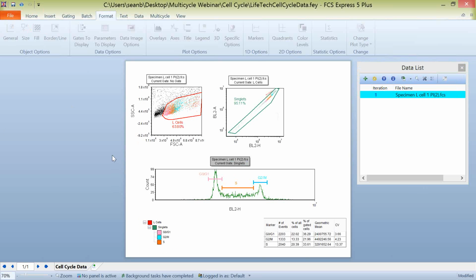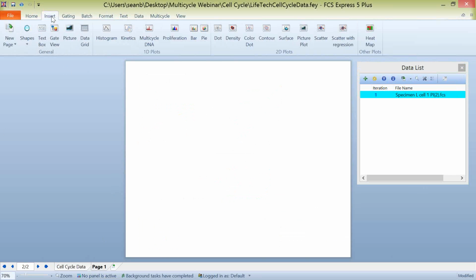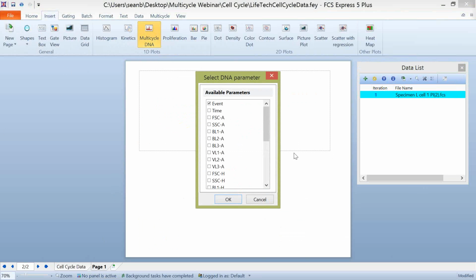But the idea with this data is that we've set up a scatter gate, we've set up a doublet exclusion gate, and our fluorescent parameter to be using here is our BL2 parameter. So I'm going to create a new page and show you how to insert a multicycle DNA analysis plot. Very simply, you click on the Insert tab, you choose Multicycle from our 1D plot selections, and you draw an object on the page. When you draw an object on the page for your multicycle DNA plot, FCS Express is going to prompt you to choose a parameter to use for your DNA analysis. In this case, BL2A is the DNA fluorescent stain, or the parameter where that stain was collected, so we will click OK.